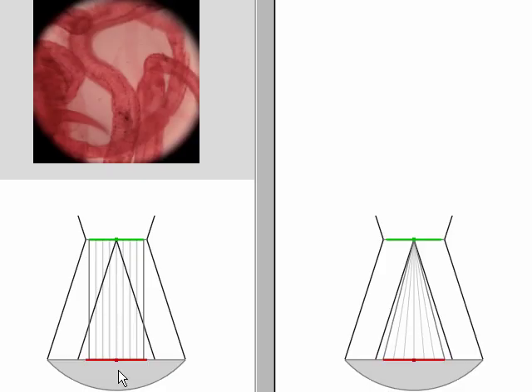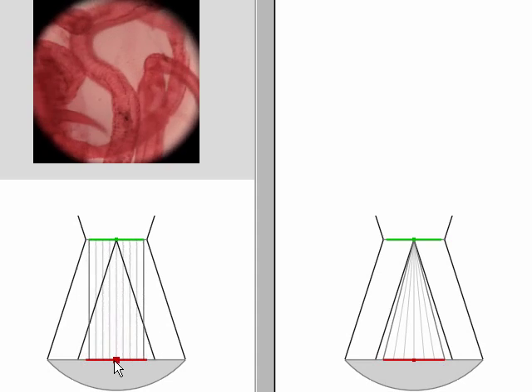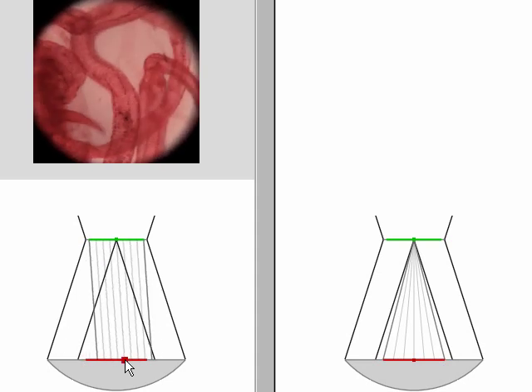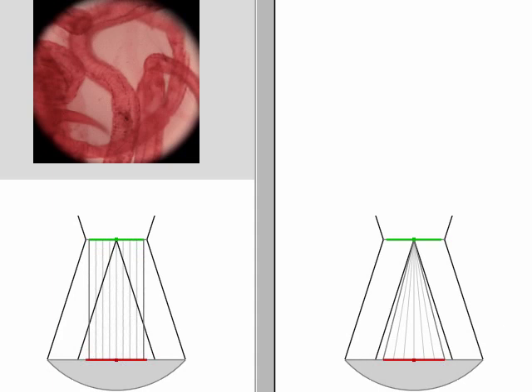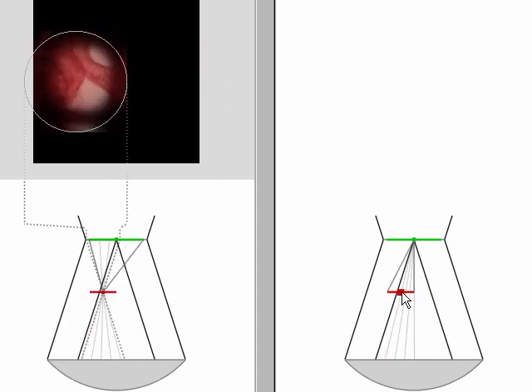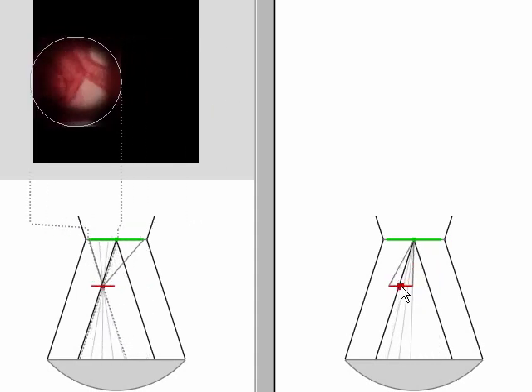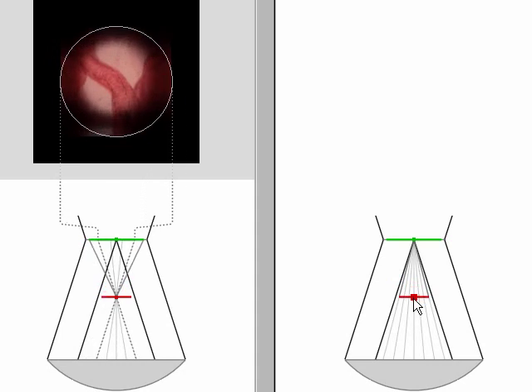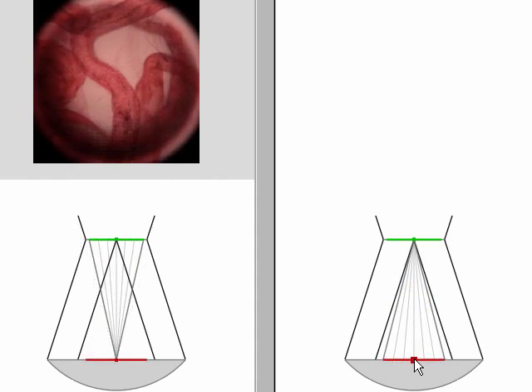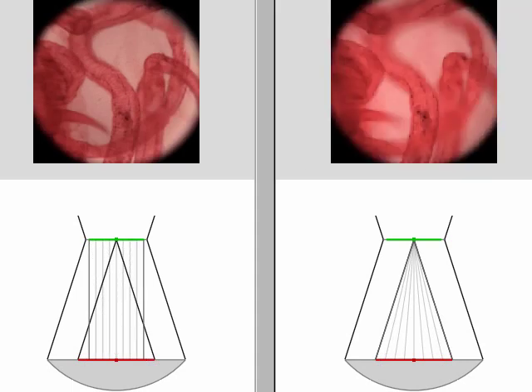Loading this image into our interactive viewer, we can produce oblique orthographic views, at least up to the limit of rays captured by the objective, and we can also produce perspective views, even some wide-angle perspective views, again limited by the rays captured by the objective. Remember that the parallax we see here is not usually available to the microscopist, because microscopes capture only a single head-on orthographic view.